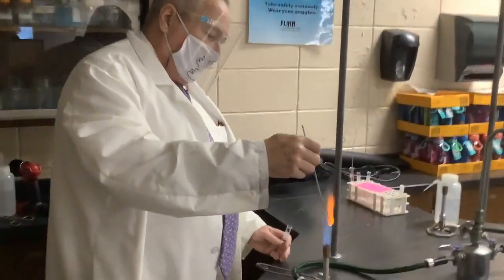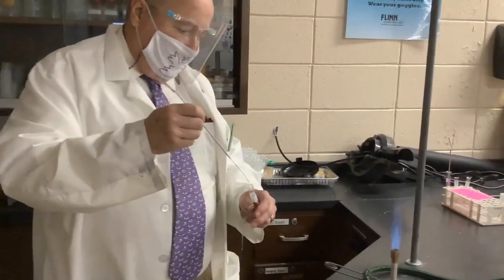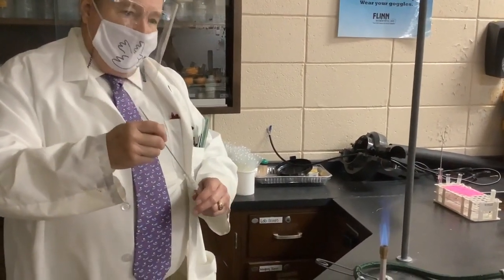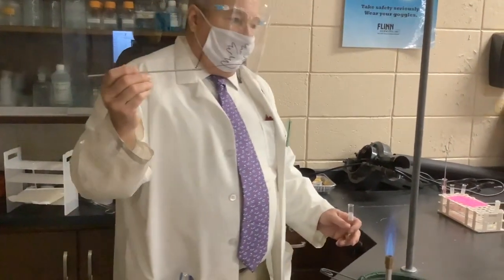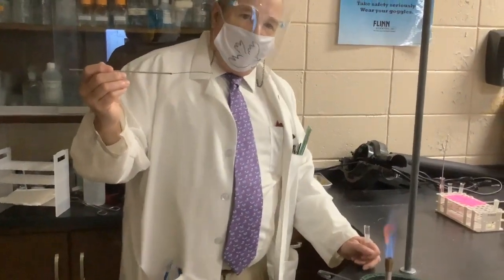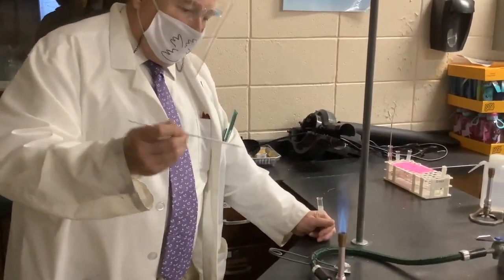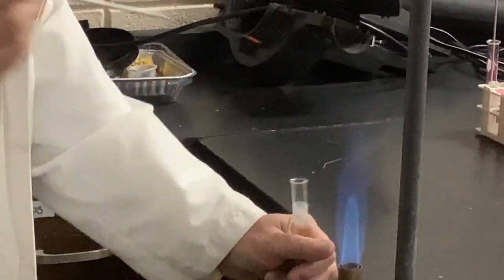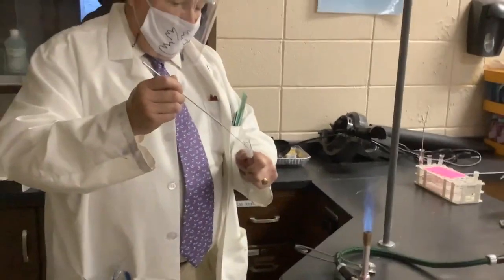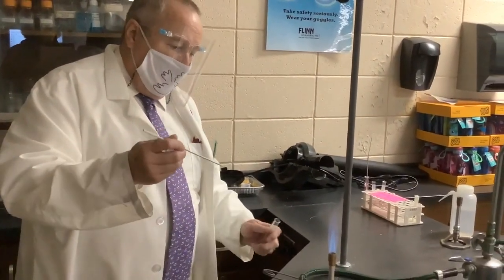The procedure calls for us to heat the loop to glowing, and then I will cool it off, and the tiny loop has a bit, and you have to watch quickly on this one. It will quickly give me a pale yellow or yellow-green flame and then go back to orange. That was it. Some of them, as you'll see, will persist longer.